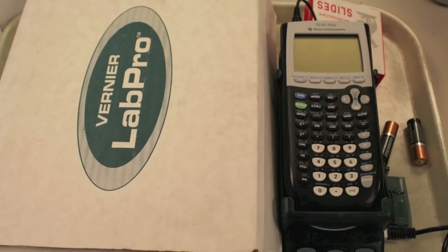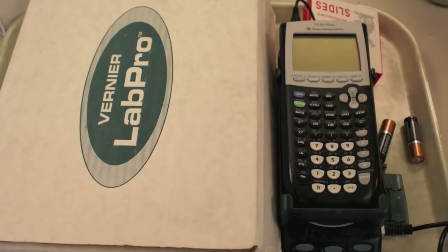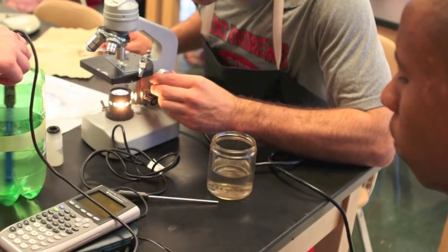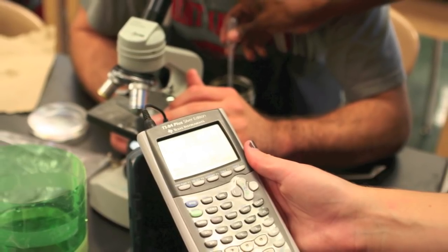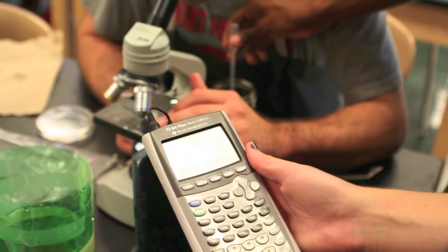Then we'll be using Vernier LabPro gear, which is high quality professional grade lab equipment, in which we'll be measuring things like dissolved oxygen, pH, and different chemical profiles that we need to know about to make a good assessment of the pond.